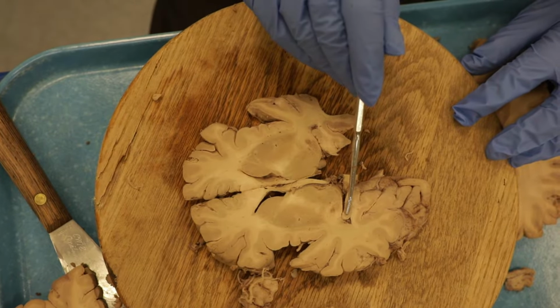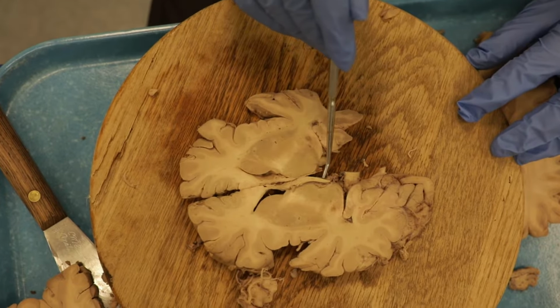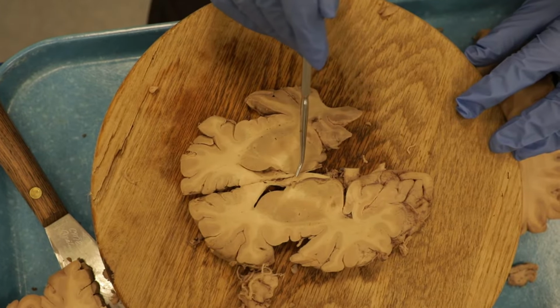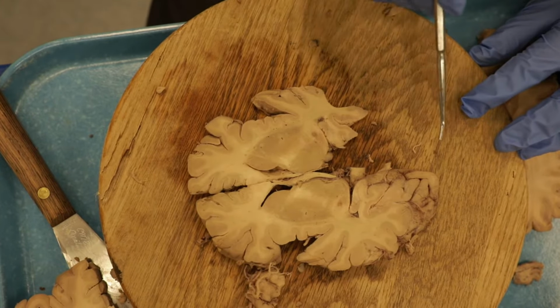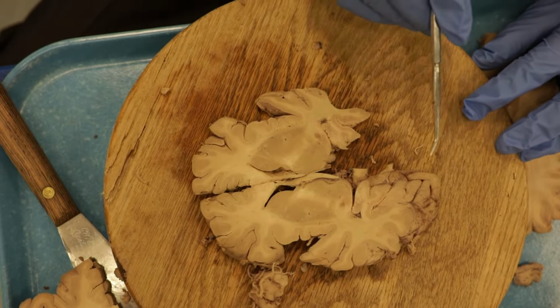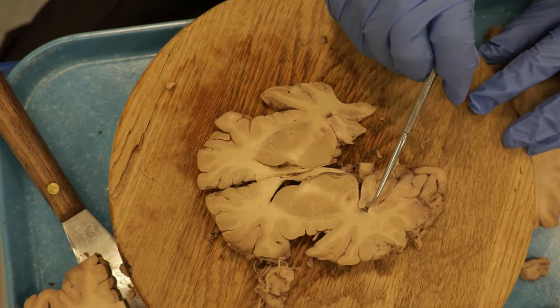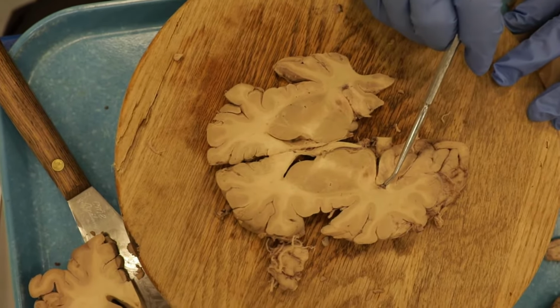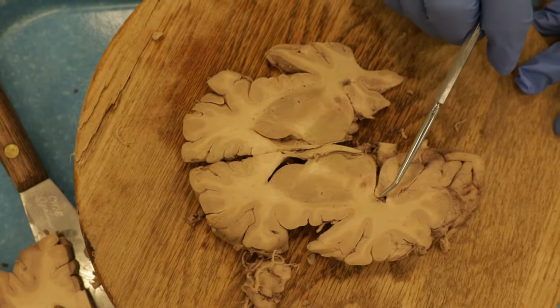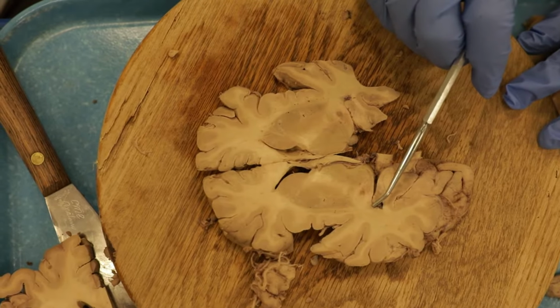So remember, from the hippocampus, the columns of the fornix, we saw last time how they went out like this. So it's from the hippocampus to the fornix, and then eventually here we'll come to the mammillary bodies as we get down to the level of the hypothalamus. Okay, so this is the temporal horn of the lateral ventricle, and look, there's some choroid plexus in there. Okay, so above that, then we still have some neurons here. So this is the tail of the caudate.